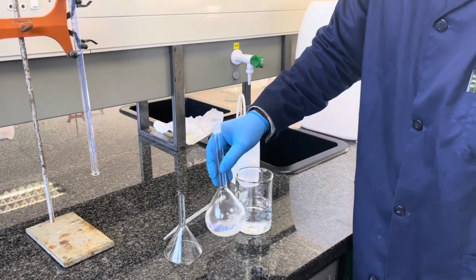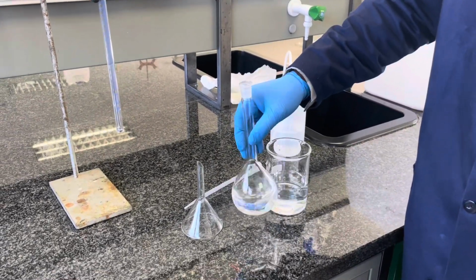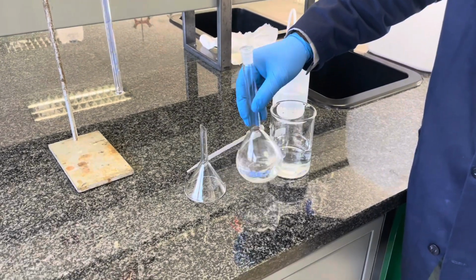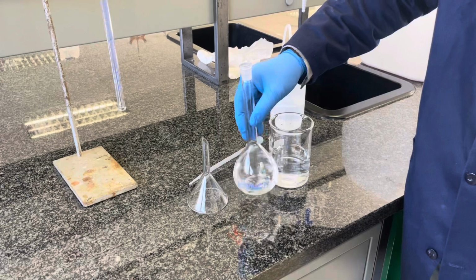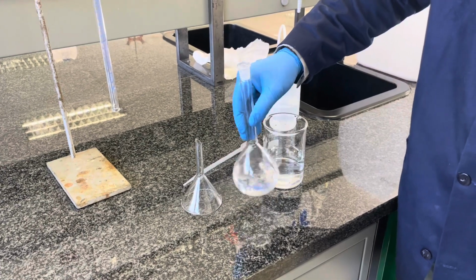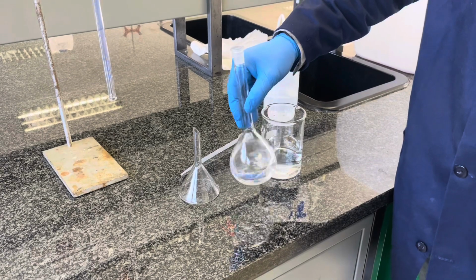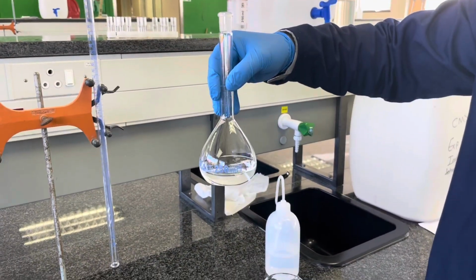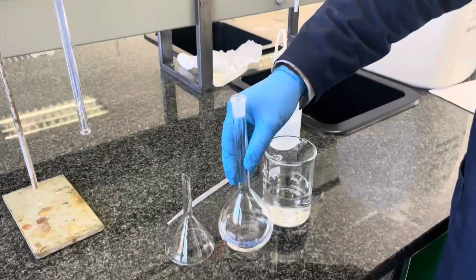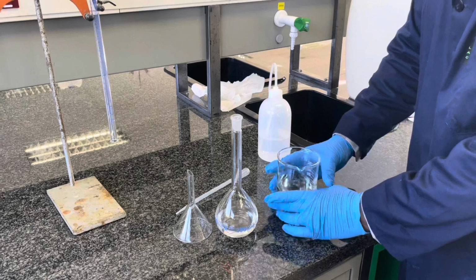Then, dissolve the salt first while the volumetric flask is not yet completely filled. This will allow you to first homogenize the solution at the bottom before filling the volumetric flask to the line indicating an exact dispensed amount. If you dispense the amount to the line beforehand, you will have trouble dissolving the salt.